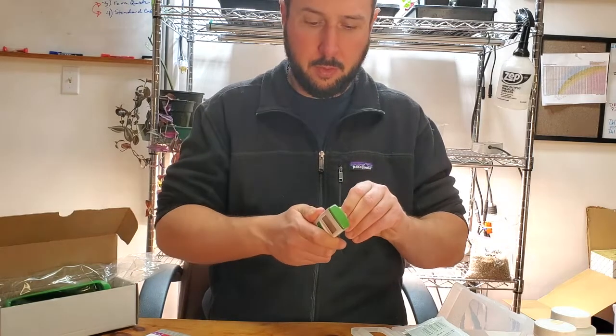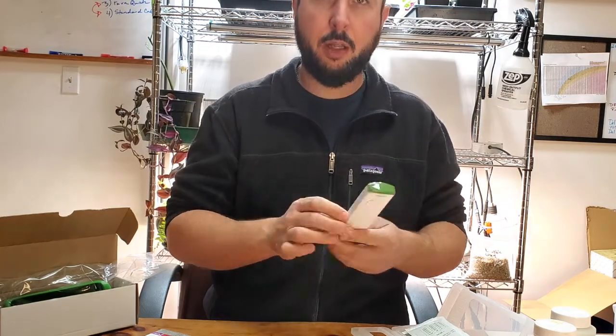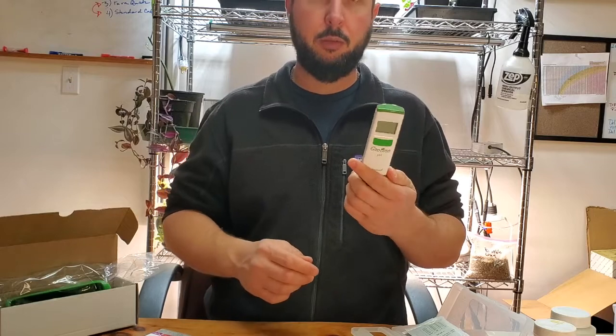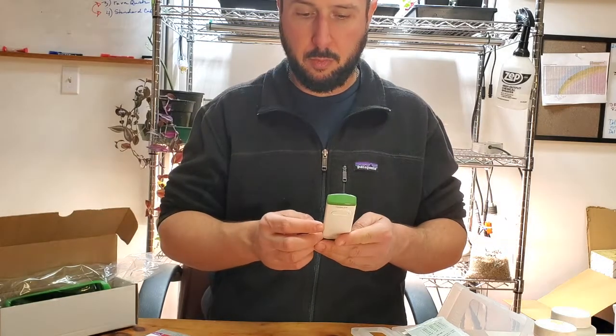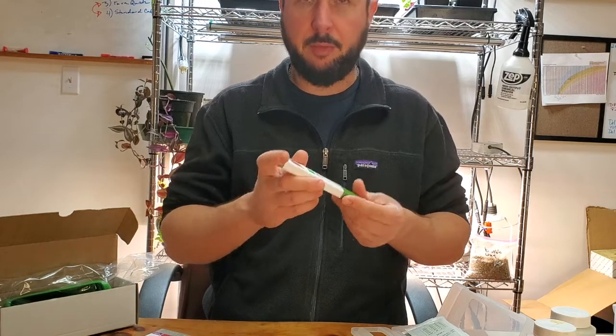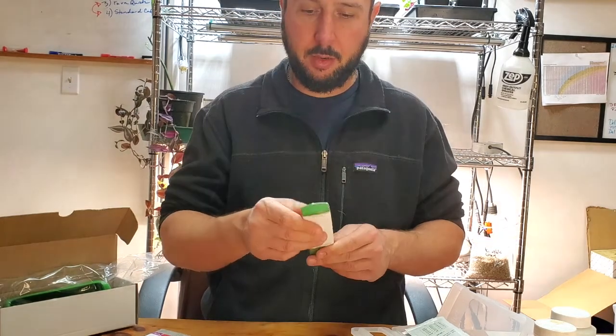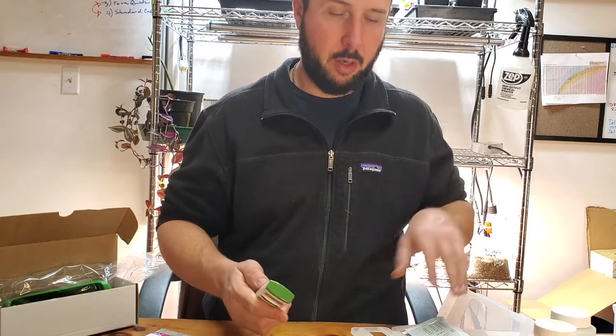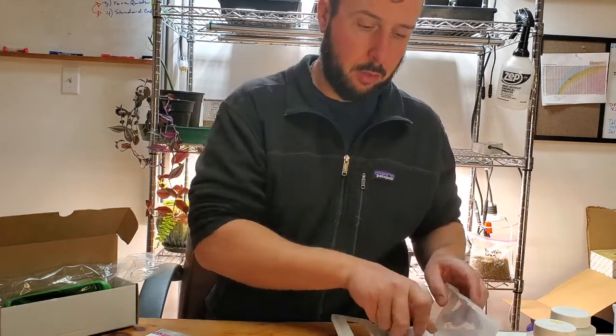We'll get into the function of this. There's a startup to it. Everybody's familiar with these Hannas - they've got another level of brand and quality recognition if you run into quality garden tools.